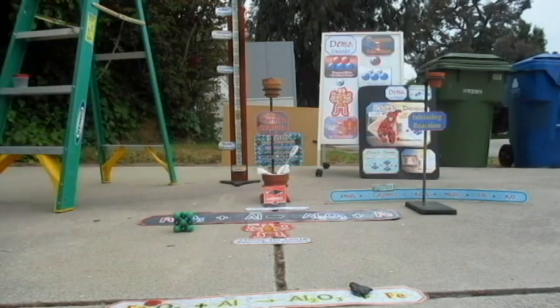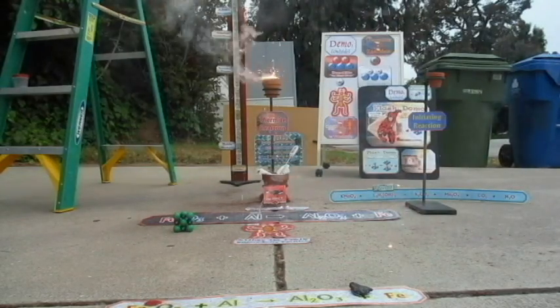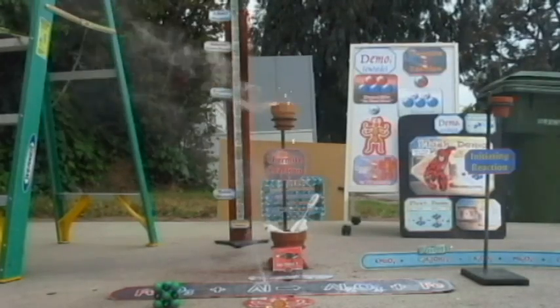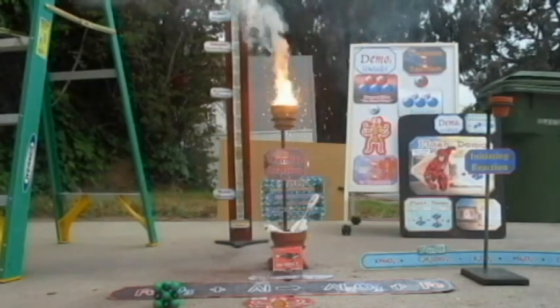All right. So Ian, you can move up to squirt it. You can move up to here and then step back. He's squirting right now. Squirt that, not the camera. Watch it. Stand back. Here it goes. That's going to get it going. That's going to get the thermite going.